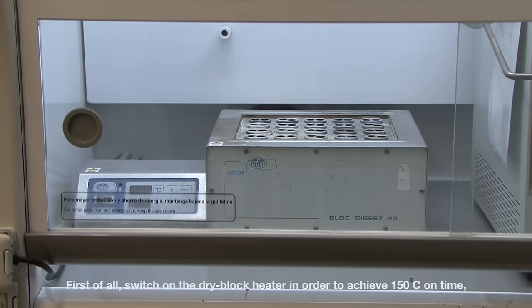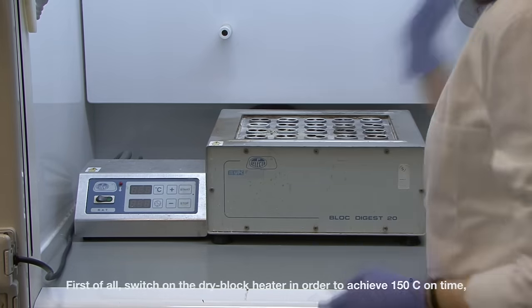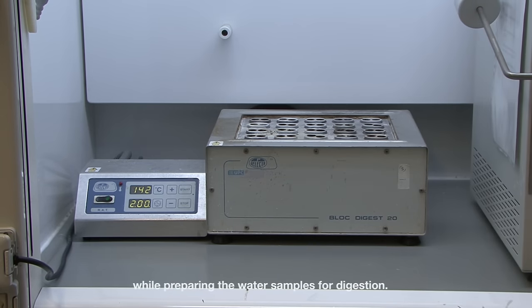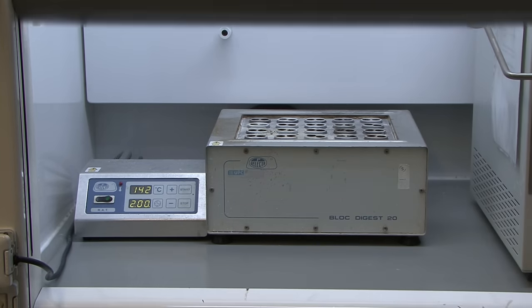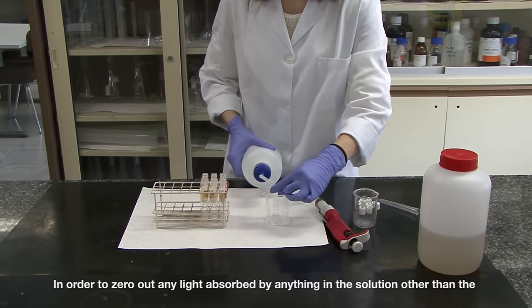First of all, switch on the dry block heater in order to achieve 150 degrees Celsius on time, while preparing the water samples for digestion.